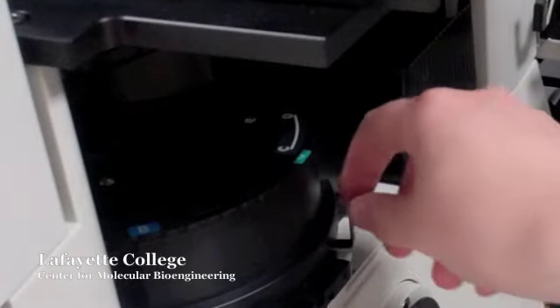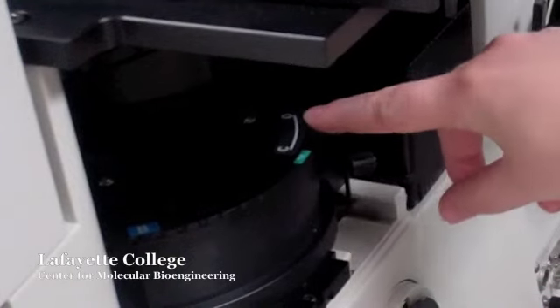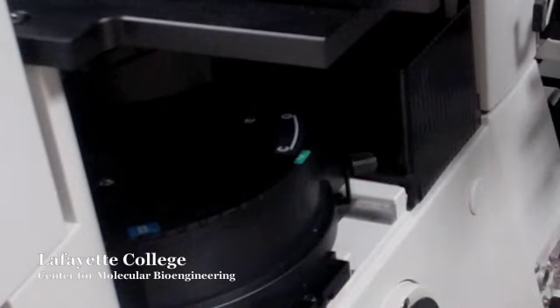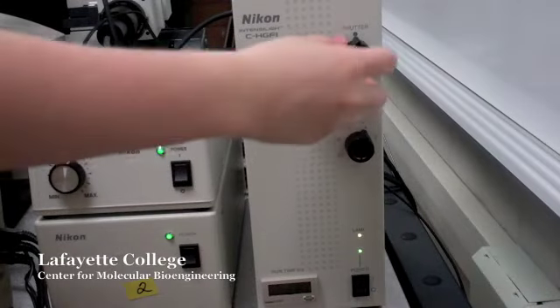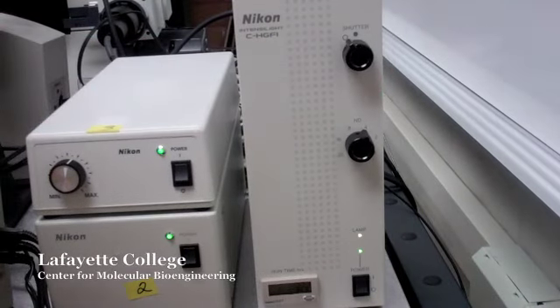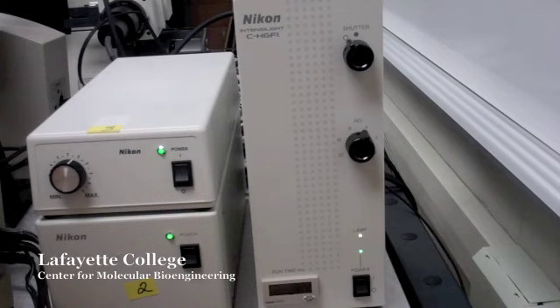Switch the shutter to the open position. The shutter on the microscope is labeled O for open and C for closed. The shutter can also be opened and closed from the Intensilite box. If the fluorescence imaging is not working, check that both of these switches are in the open position.